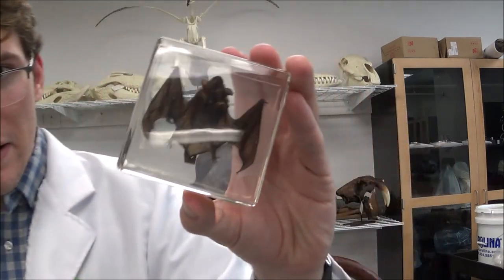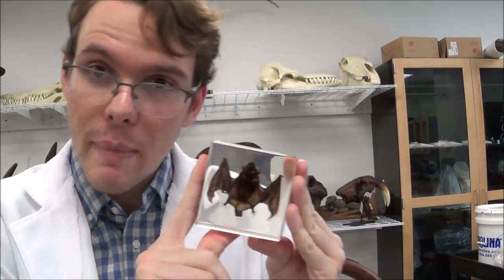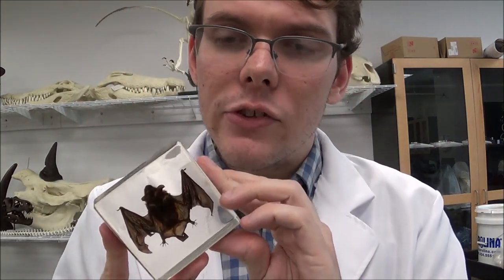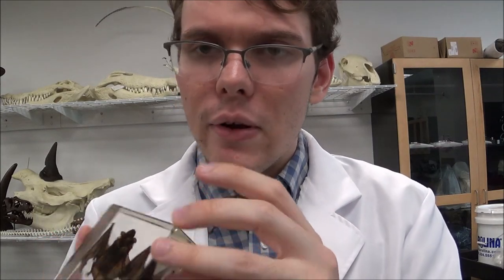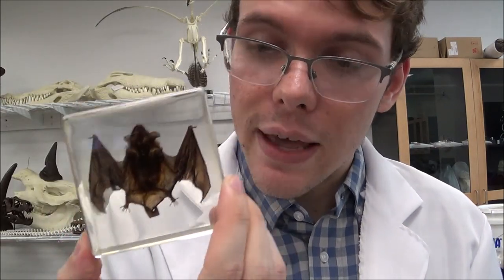Alright, Procedure 3. We're going to look at our first whole-mounted mammal here, and this is from the order Chiroptera — this is a bat, specifically a Japanese house bat. The reason we look at bats in our mammal lab quite a lot is because they're very unique among mammals. They're the only mammals capable of true, sustained flight. There are mammals who can glide through the air, but bats are the only ones capable of actual flight.